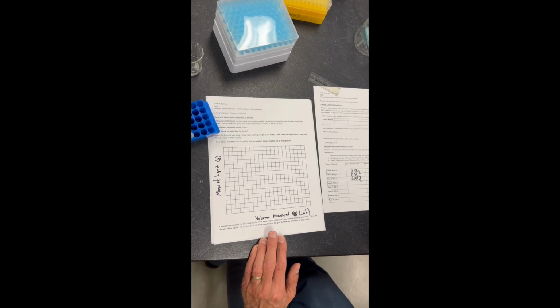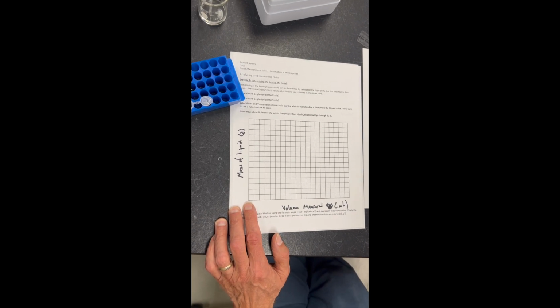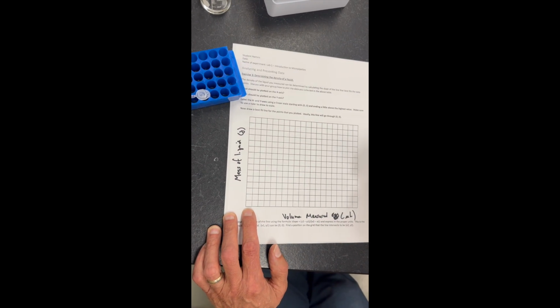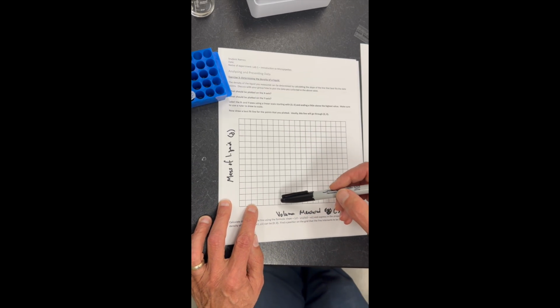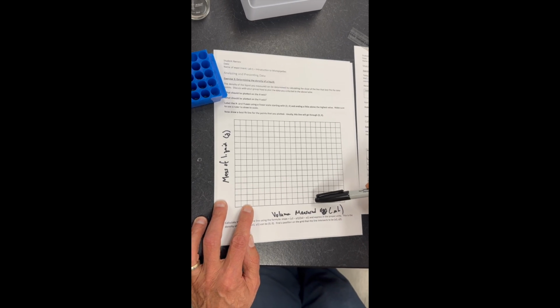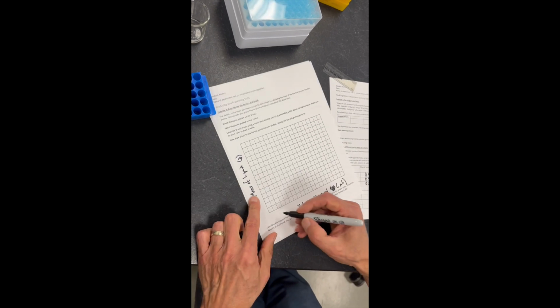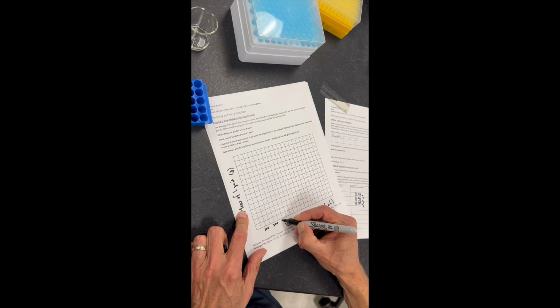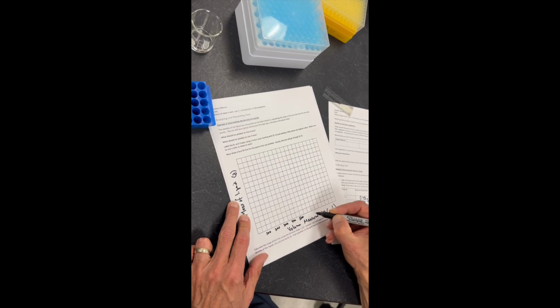Yeah. Okay, so what we're going to need to do is label the x-axis with the different volumes that we have. And so we kind of have to count how many lines we have across. 1, 2, 3, 4, 5, 6, 7, 8, 9, 10, 11, 12, 13, 14, 15, 16, 17, 18, 19. We have 20. And so that means that each one of these lines would be 50 microliters. So this is going to be 100 microliters, 200. So we label our graph here.